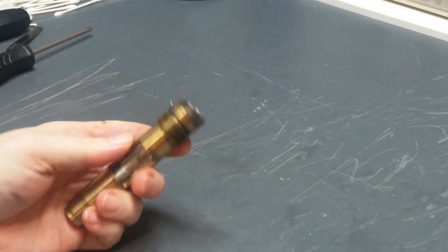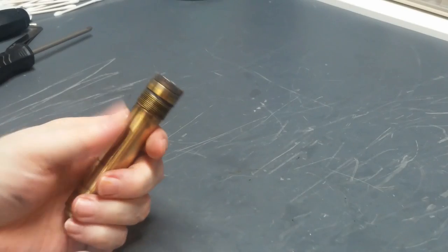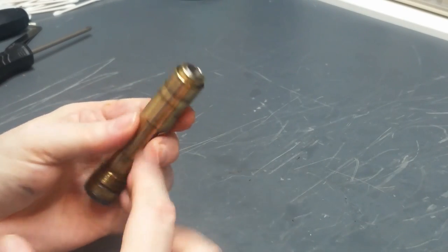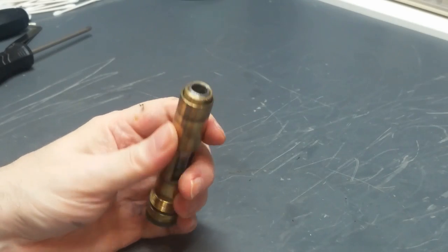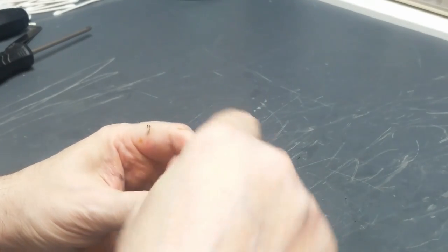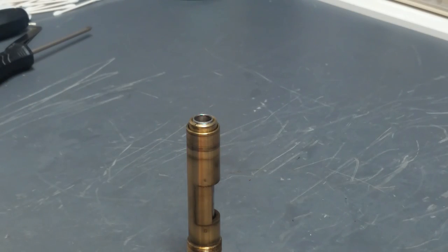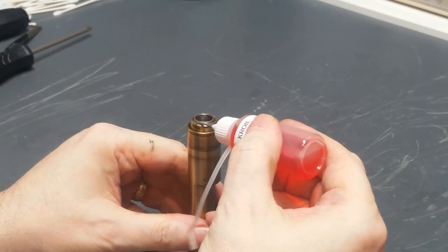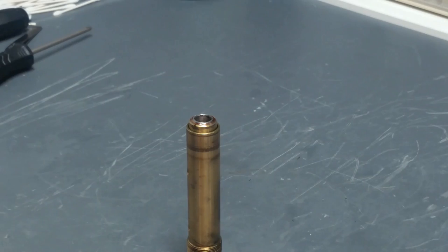Okay, so off camera, I took a paper towel and a little bit of acetone and wiped off some of this grease here so that I'd have a chance of handling it without it slipping and totally messing things up. So what I'm going to try to do now is remove this retaining nut that holds the whole thing together. And the way I'm going to do that is, first I'm going to use some more penetrating oil all the way around this thing. And now I'm going to give that time for the oil to do its work. Be back in just a little bit.